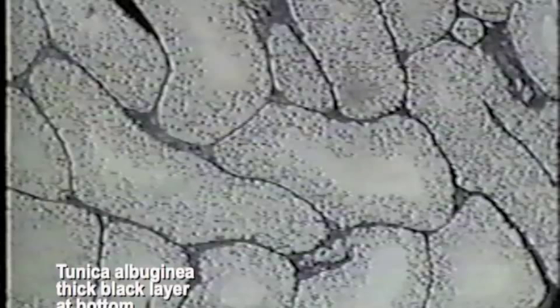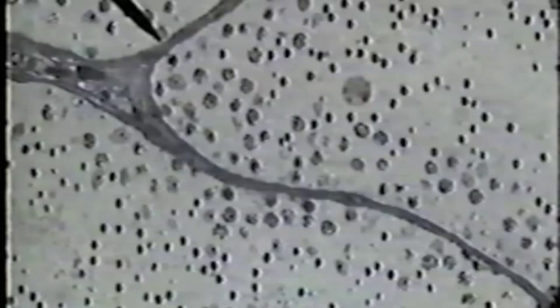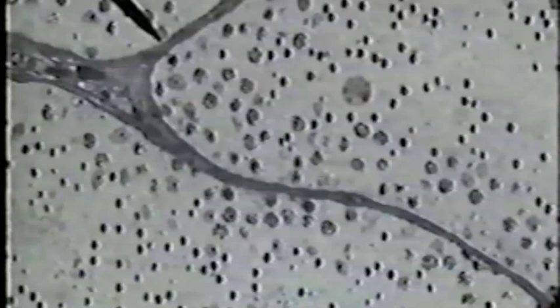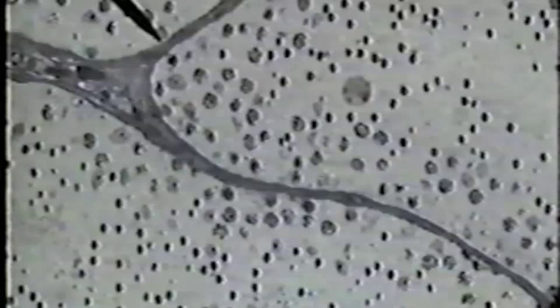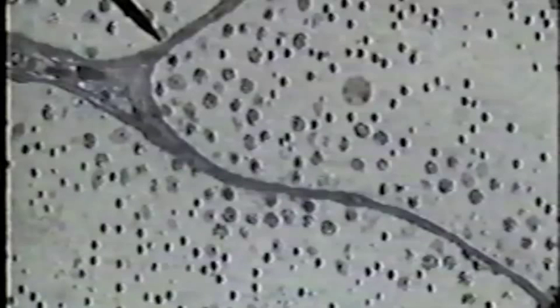On low power we are looking at a slide of the testis. We can see cross-sectional cuts through the seminiferous tubules. The pointer is on the basement membrane of a seminiferous tubule. Within the seminiferous tubule we see cells undergoing spermatogenesis.